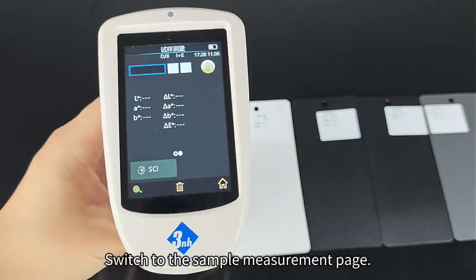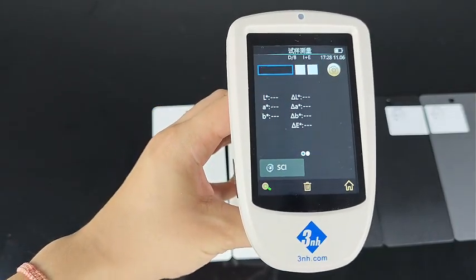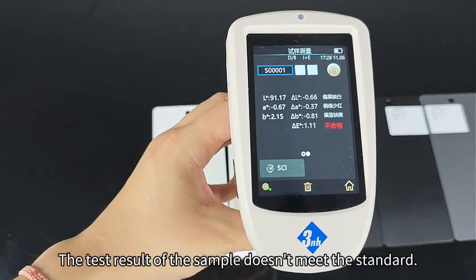Switch to the sample measurement page. The test result of the sample doesn't meet the standard.